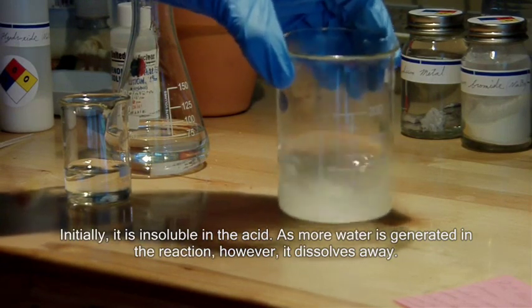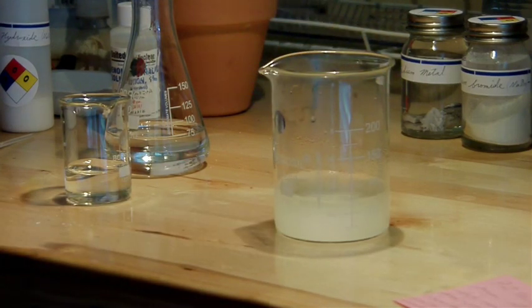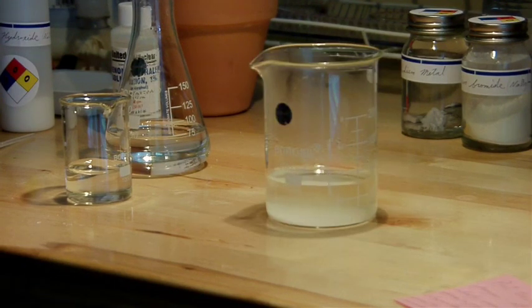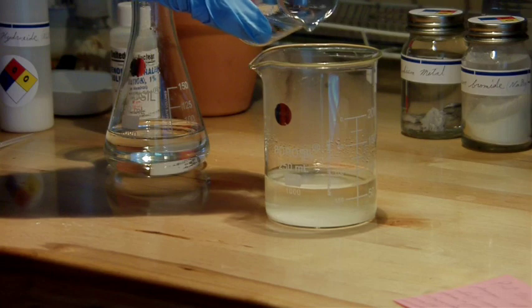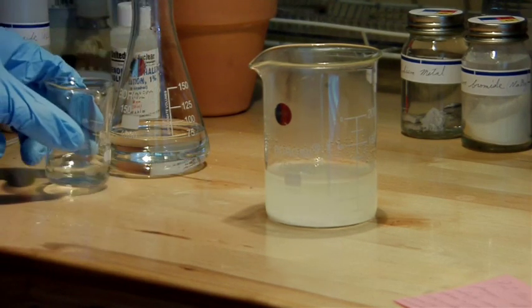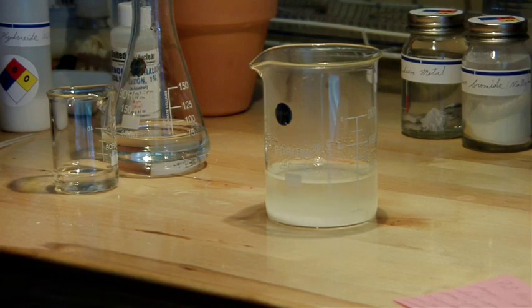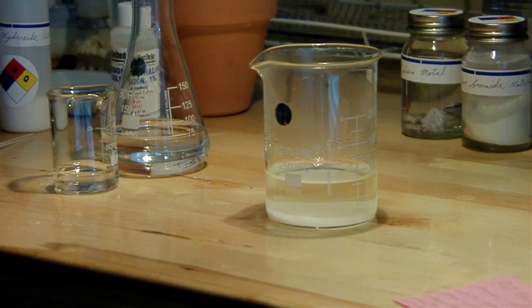Or rather a beaker full of pink salt water, once the indicator changes colors. And this might take a while, so I'm going to speed this up and we'll skip to the end.